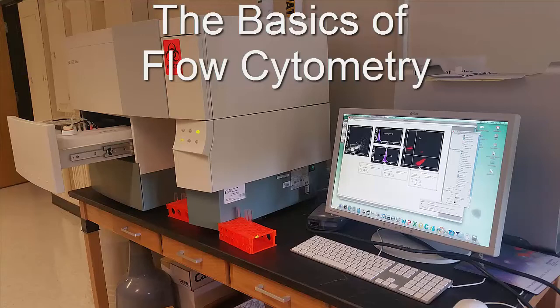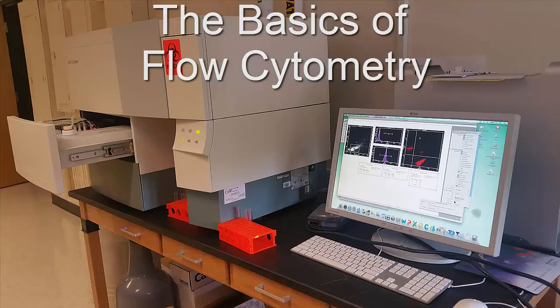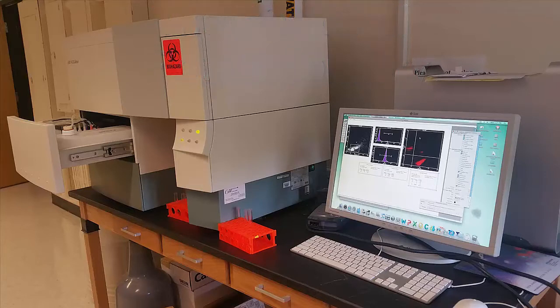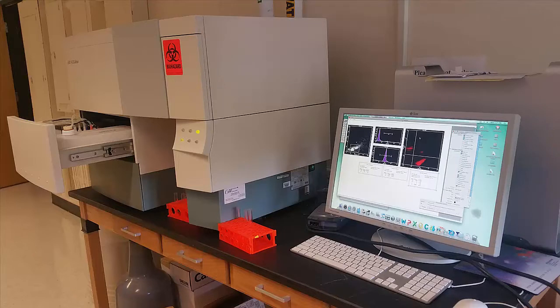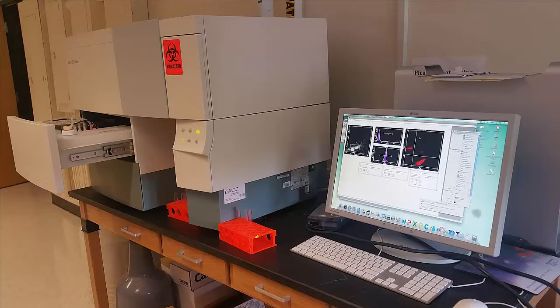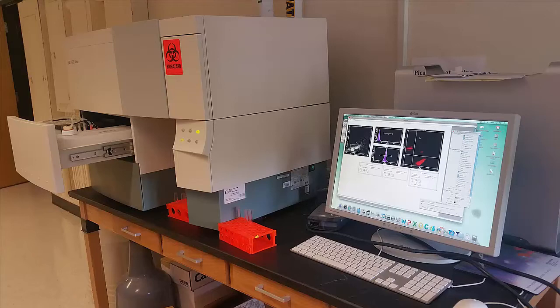This video reviews the basics of how flow cytometry works. What we have here is a flow cytometer on the left. This one is called a BD FACSCalibur, and you can see that it's attached to a computer. The computer has a program that will allow us to visualize, as the cells are running through the machine, how the cells fluoresce.